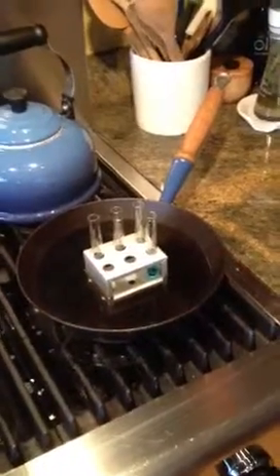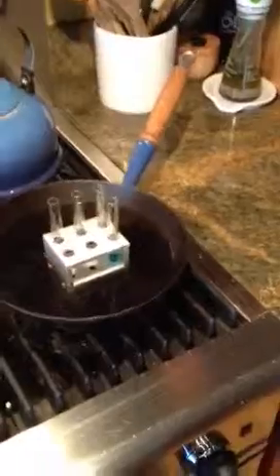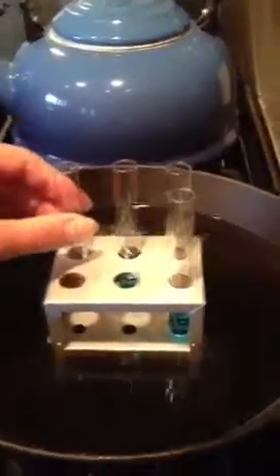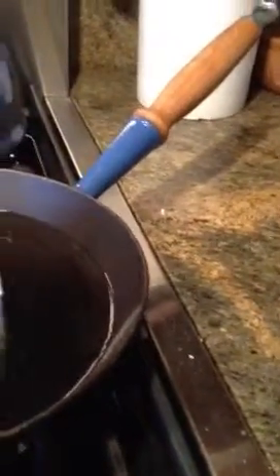Hi, so we're just finishing up our macromolecules of life testing for sugar. And so here are my test tubes. My first one, which was my glucose, turned red. My potato starch didn't do anything, it just stayed blue. Back there, my onion turned brown, and then again my distilled water turned blue.